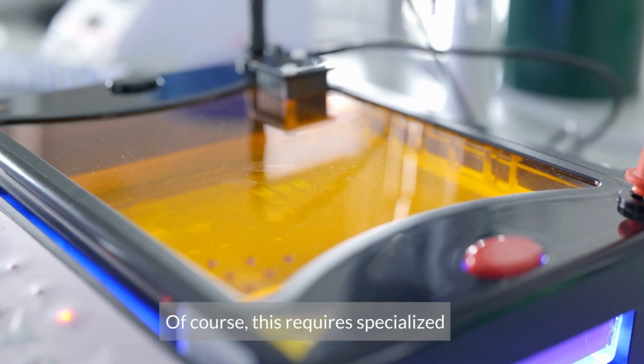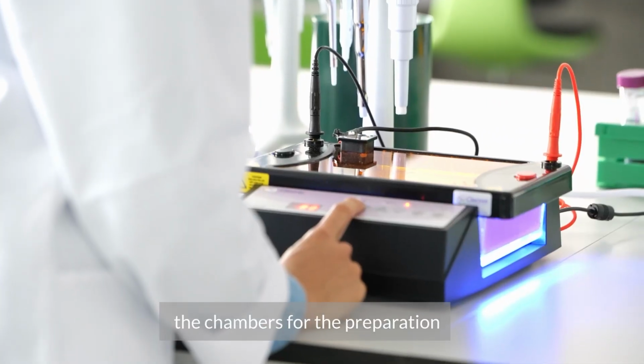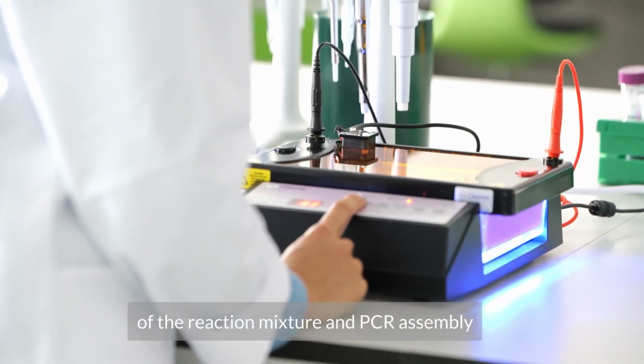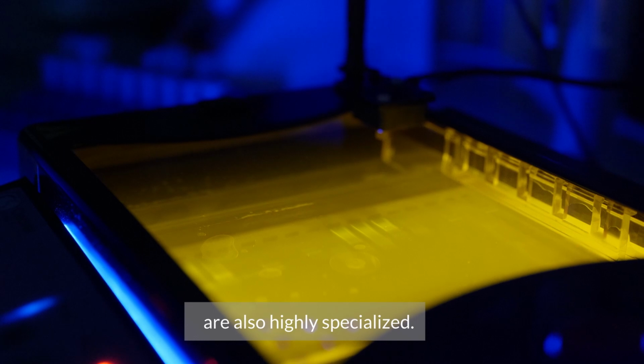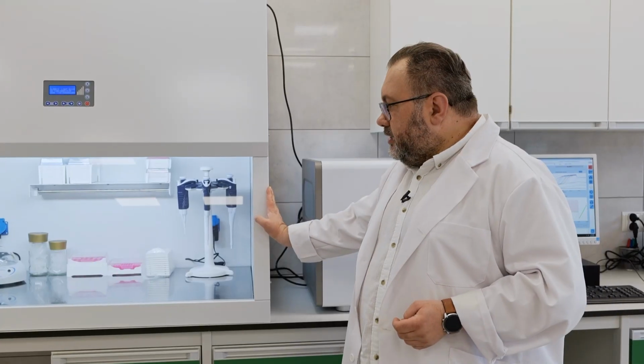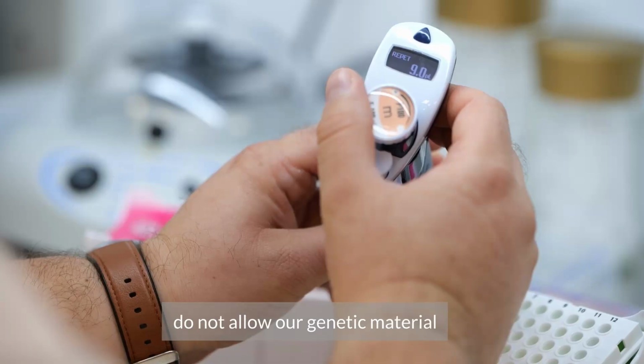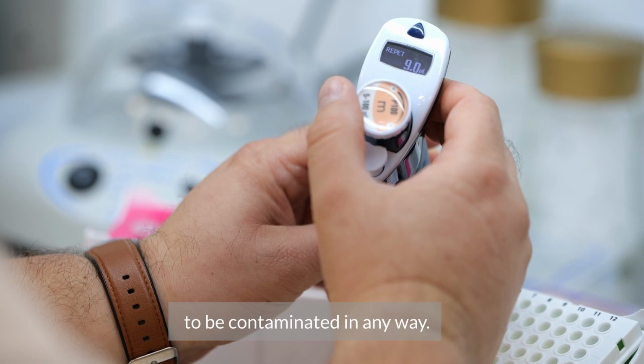Of course, this requires specialized equipment. As you can see, the chambers for the preparation of the reaction mixtures and PCR assembly are also highly specialized. As a result, proper sterilization level is maintained all the time, and the chambers do not allow our genetic material to be contaminated in any way.